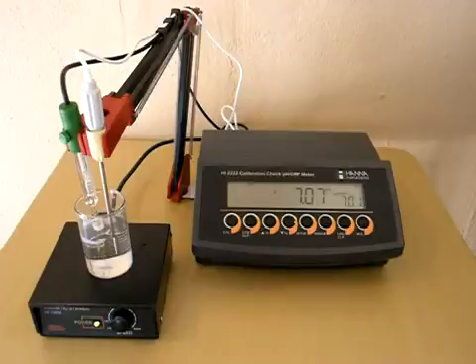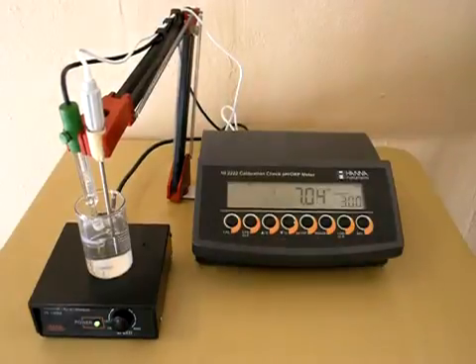We're already in pH calibration mode. We're looking for buffer 7.01. We're automatically temperature compensated. Our probe's in place. Once it's ready, you'll hear the beep, and the screen will say confirm. Simply hit confirm, and now it's asking for buffer 3.0.